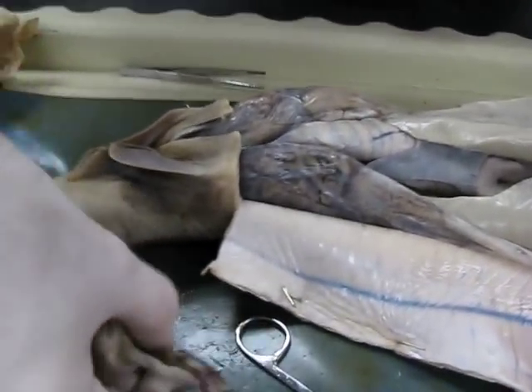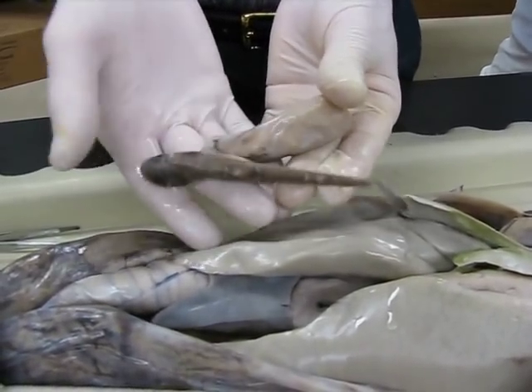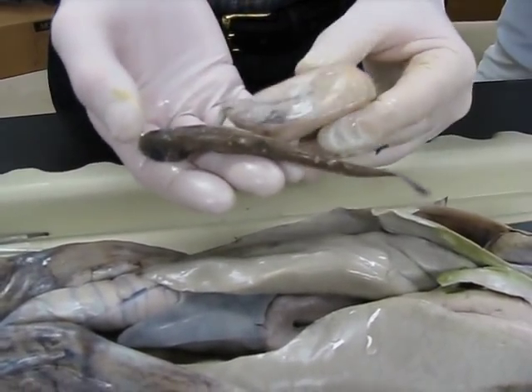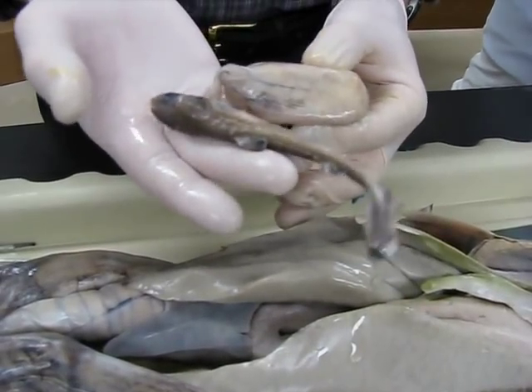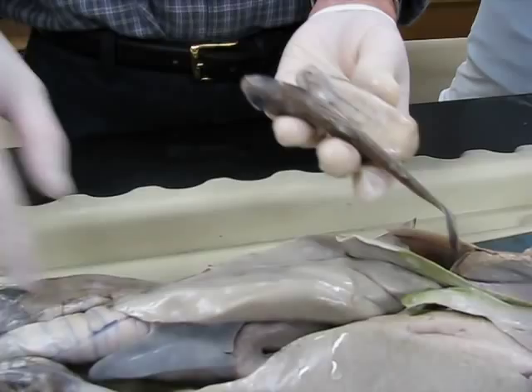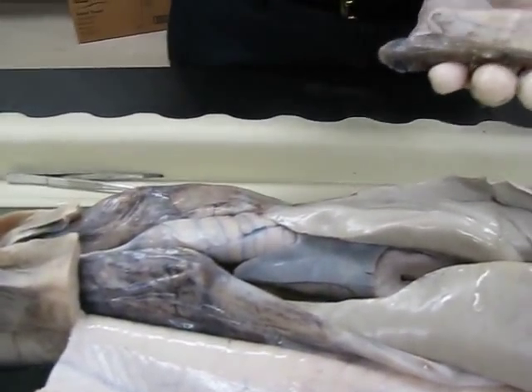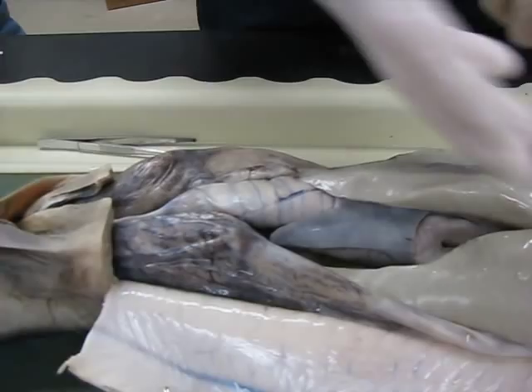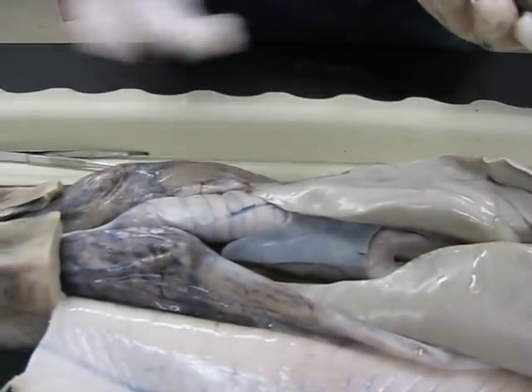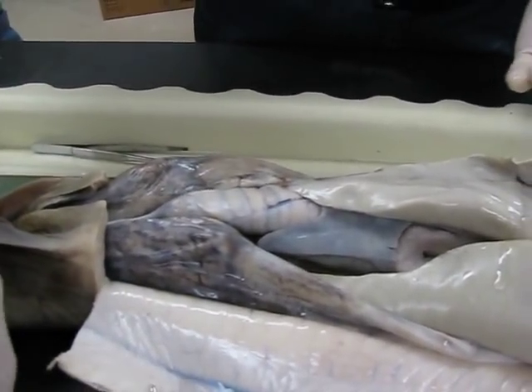What you see are these large sections here which are developing embryos. I pulled one out, so what you're looking at is the developing shark, and this is the yolk sac associated with it. There's four in this one. As they develop, the yolk sac gets smaller and smaller, the shark gets bigger and bigger, and ultimately when they're born, they leave the cloaca and swim off.